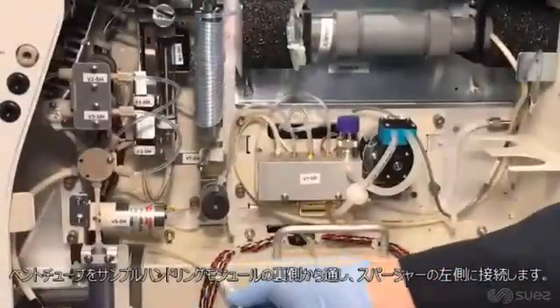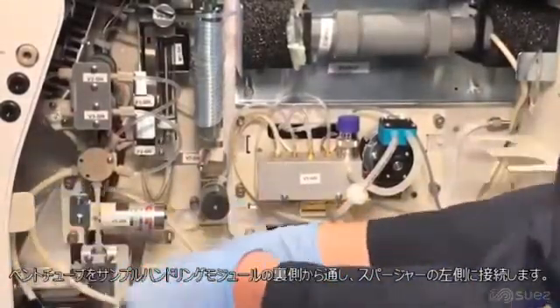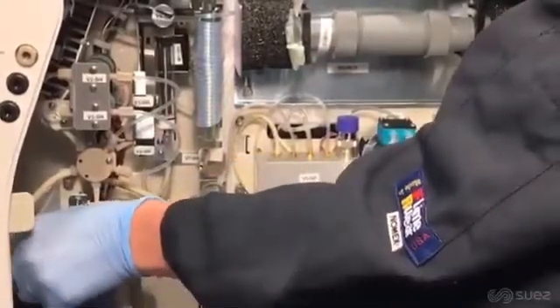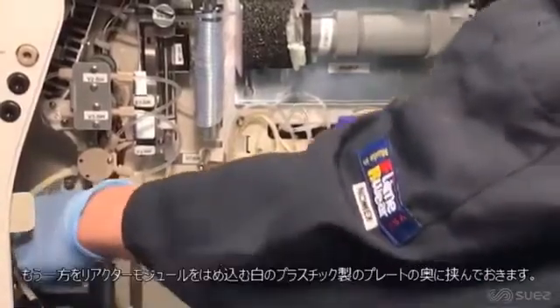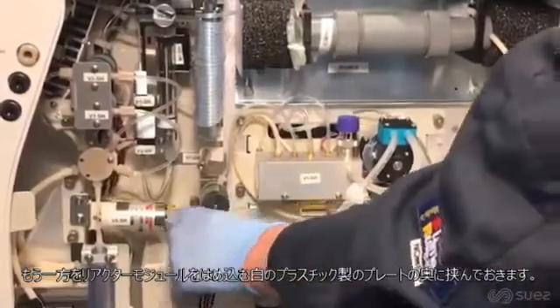Thread a new section of vent tubing behind the sample handling module chassis and connect it to the upper left barb of the sparger. Place the free end of the vent tubing through the white plastic clips running across the top of the reactor module.